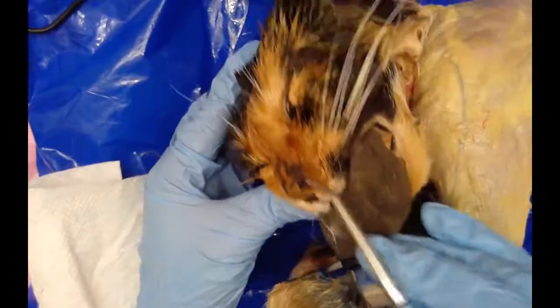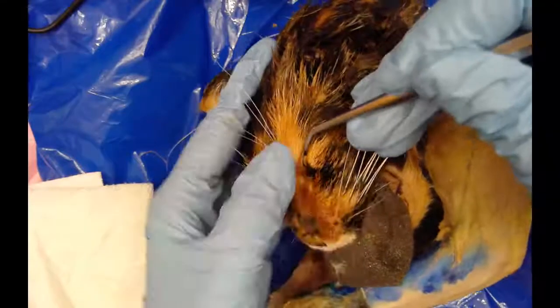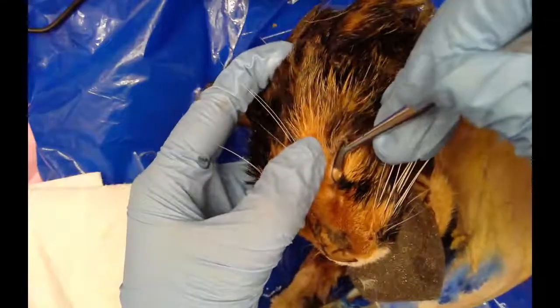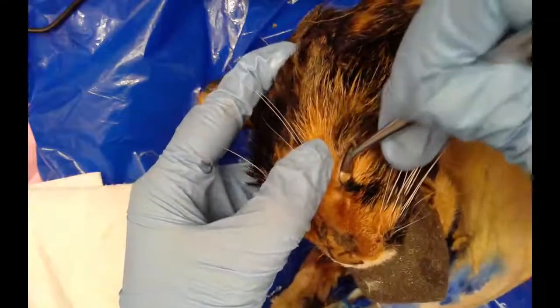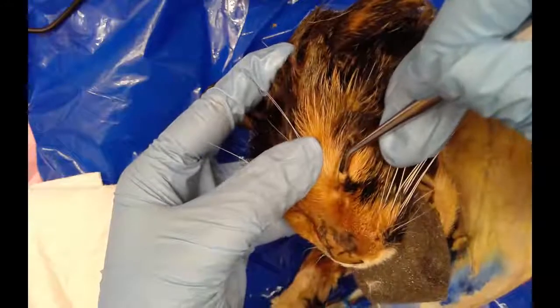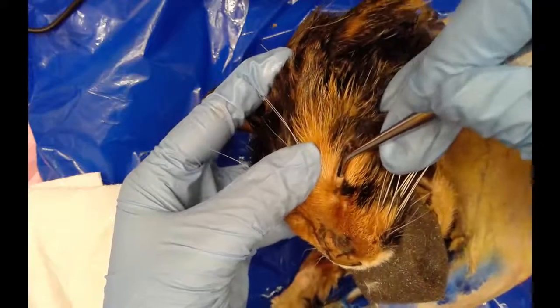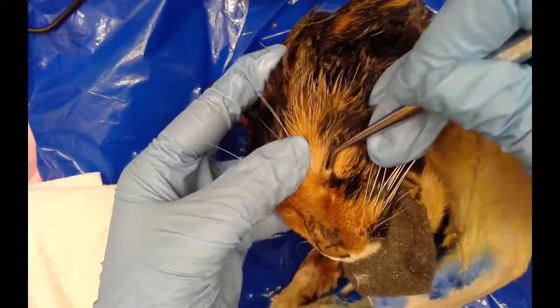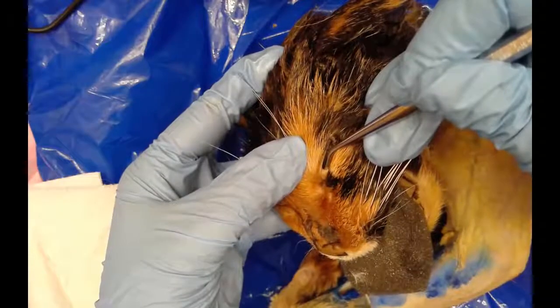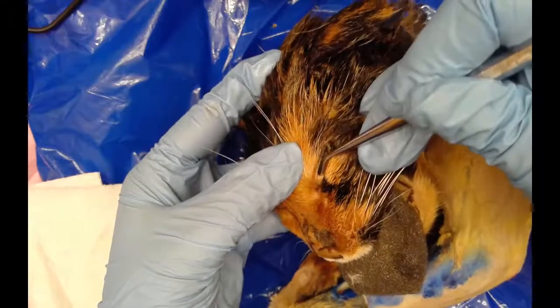If I look in her eye, I notice there is this unique white tissue. This is the nictitating membrane that I'm lifting up here with my probe. The nictitating membrane's purpose is to protect the eye.